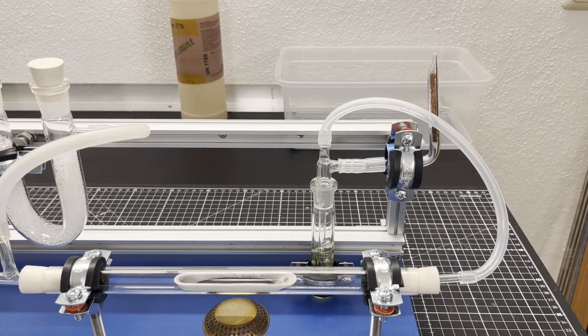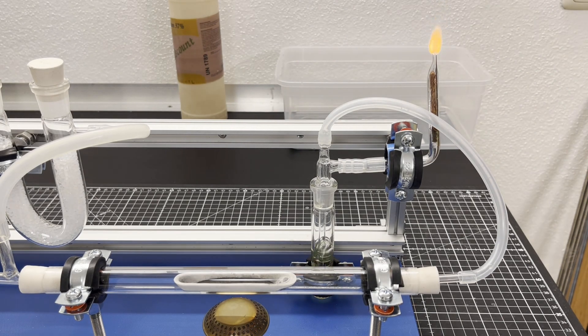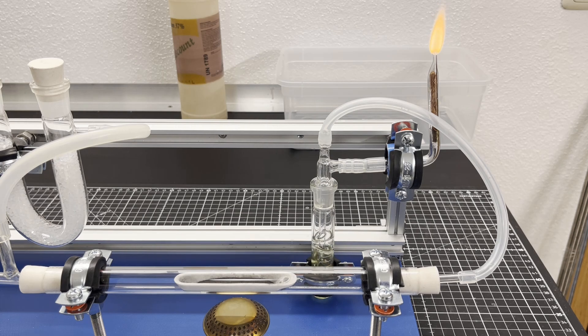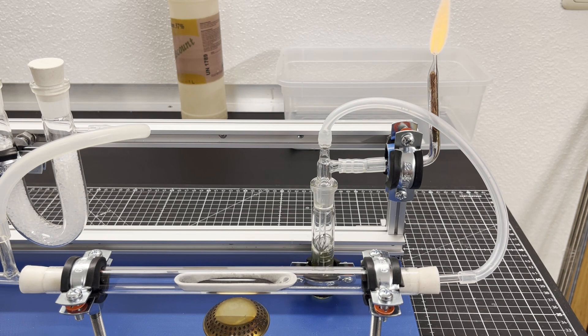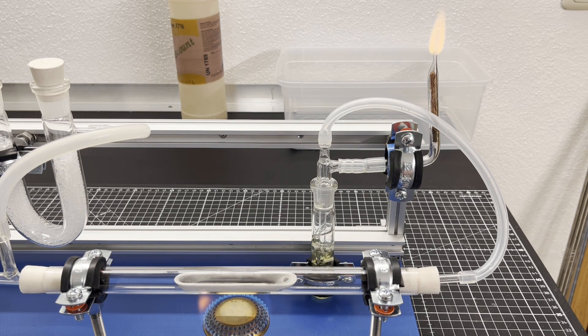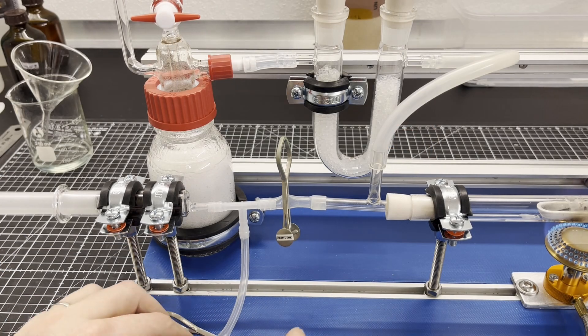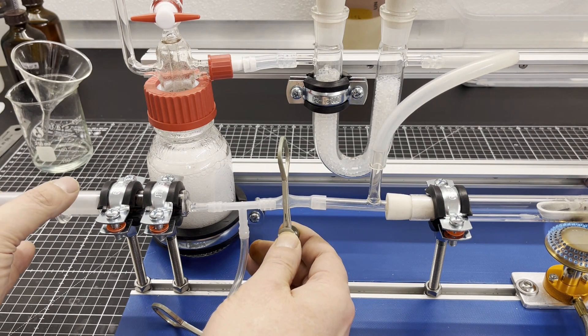Once the hydrogen production has started properly, the escaping hydrogen is ignited. The flame is clearly visible due to impurities in the copper wool. The burner is now heated up vigorously. Now nitrogen is slowly added via the gas syringe.